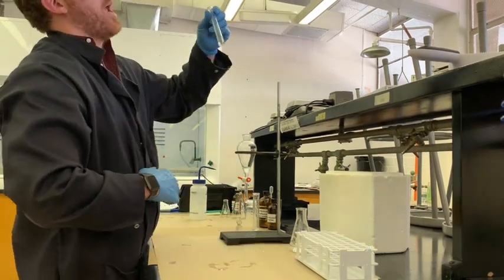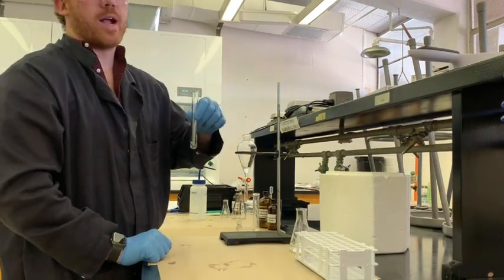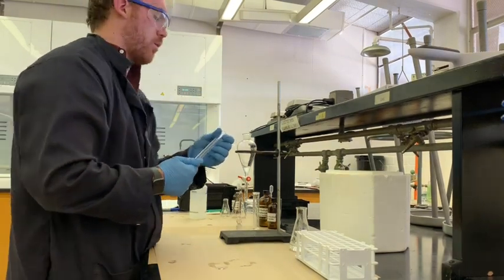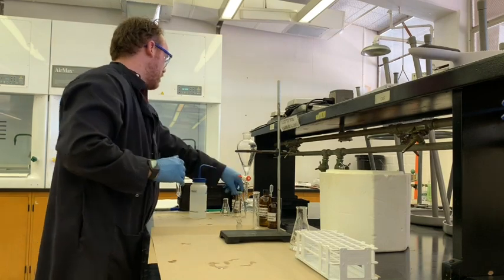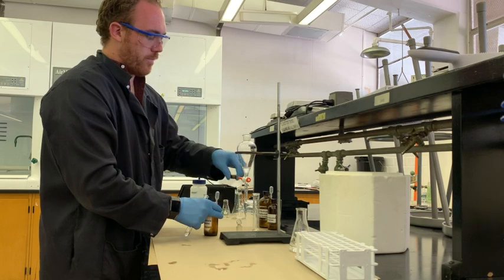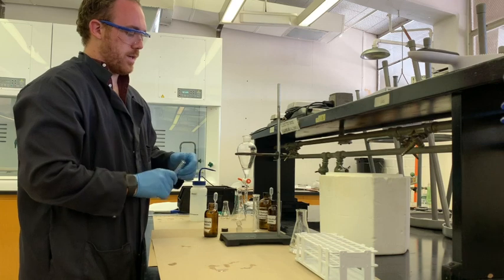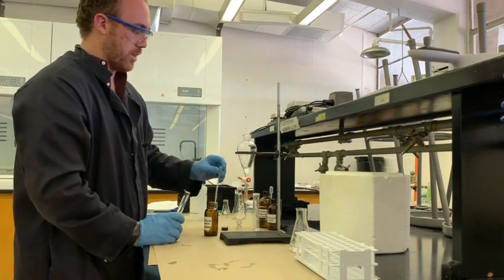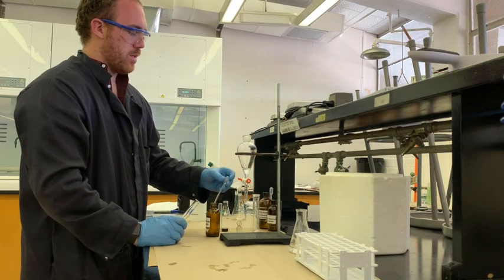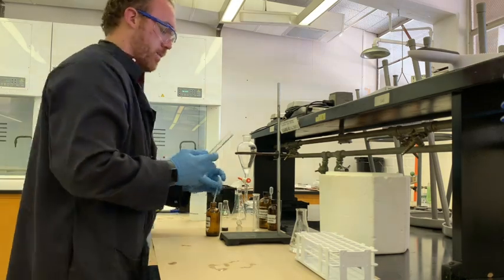Going to add a little bit of silver nitrate to it in order to see whether or not it reacts to form silver chloride. Silver chloride is a very favorable, insoluble salt to be produced. And in the presence of silver nitrate, which is a soluble silver salt, if it finds chloride that's available, it will leave solution to form a whitish gray precipitate.